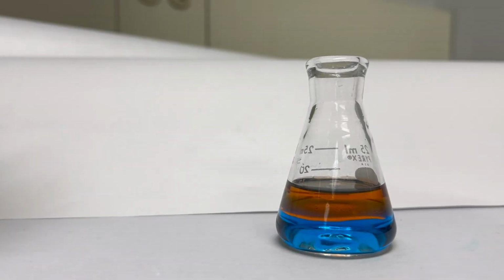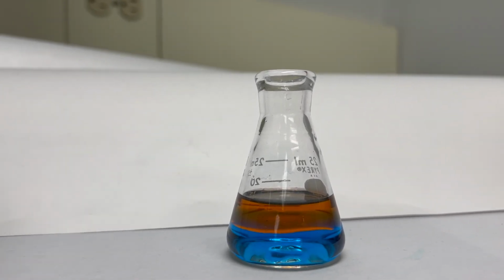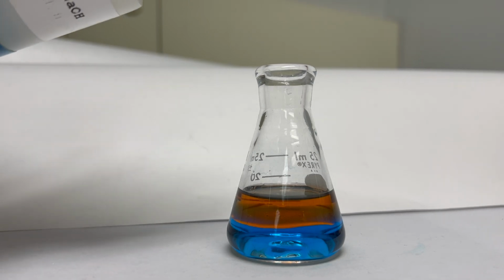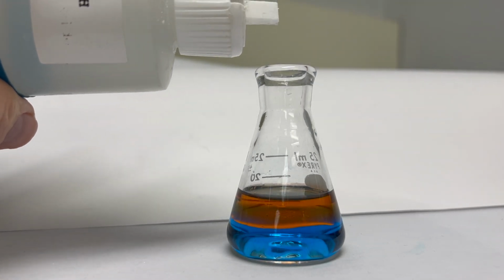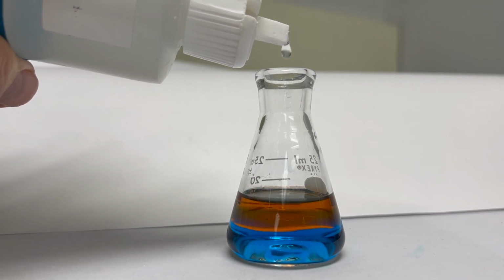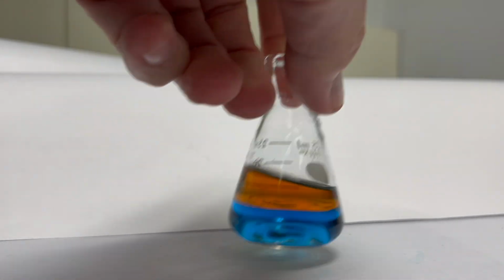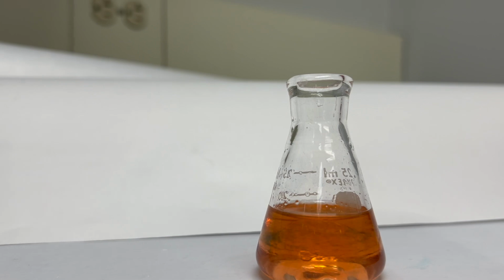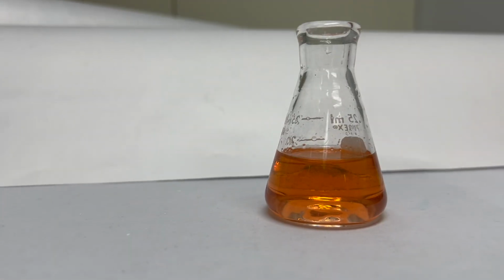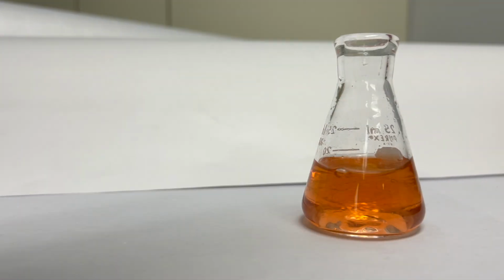We'll put a couple of drops in here. It's an aqueous solution, so it's going to go right through the ethyl acetate, as we'll see. Come on, let's put a couple of drops in there. Thank you very much. Boom. Yep, now we'll give it a swirl, make sure everything mixes. Upon mixing, we deprotonate the Nile blue, and we get it into the red form.